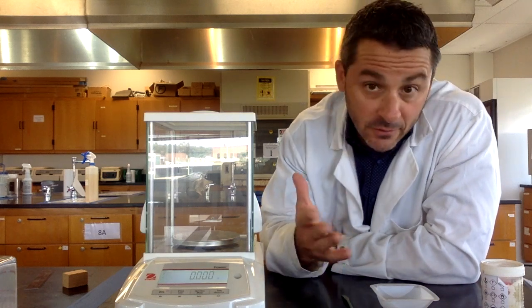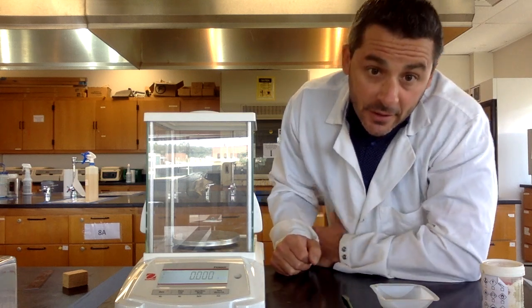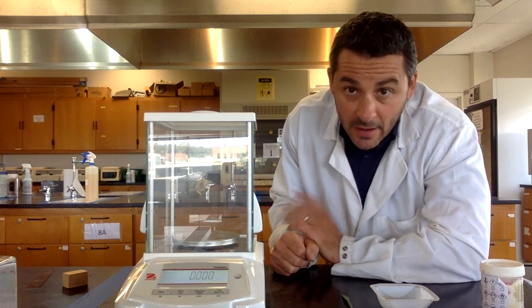You can use the balance to weigh out different solids or liquids, which is a little bit different. But the first thing, most of the time, we're weighing out solids on the balance.